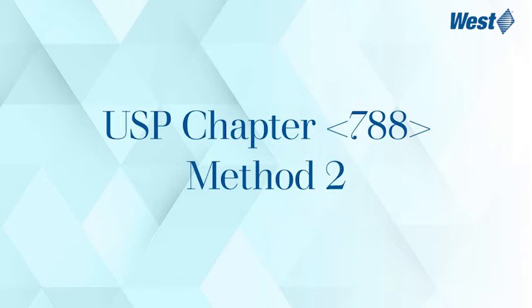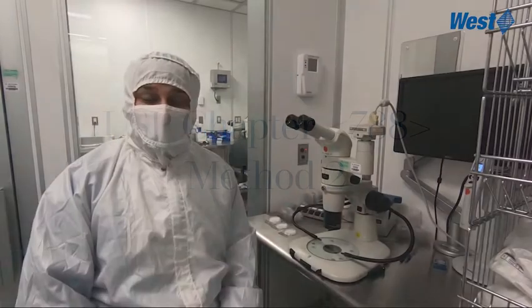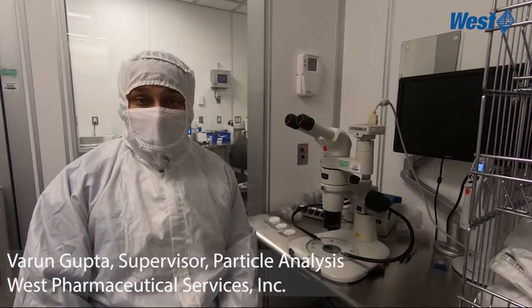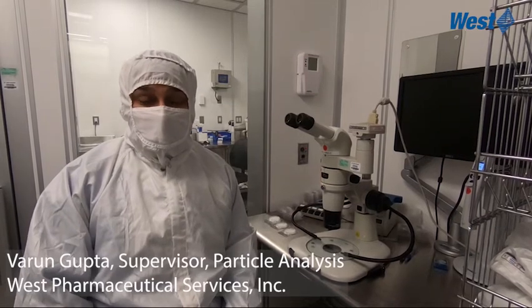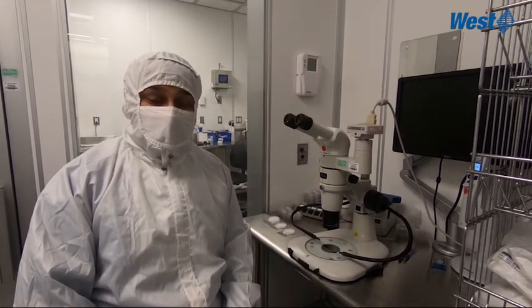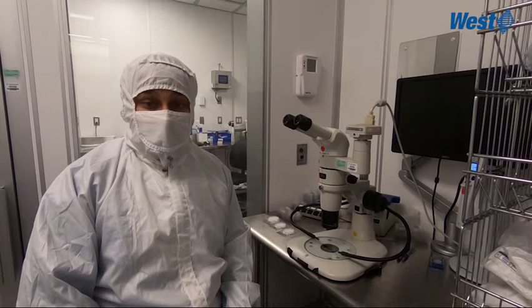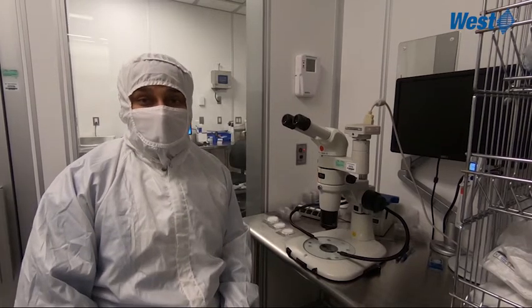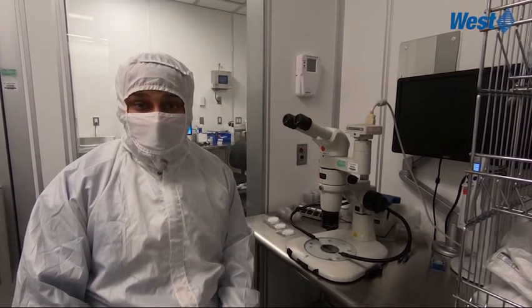Hi, today I'm going to talk about method 2 of the USP chapter 788, which is used for inspection of drug products. This method is done when method 1 is not favorable or your drug product is actually failing method 1.